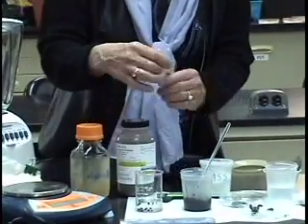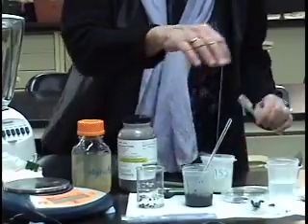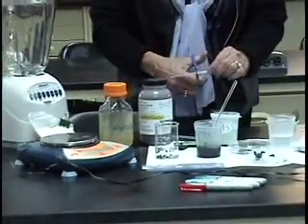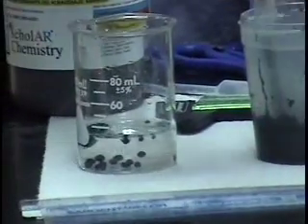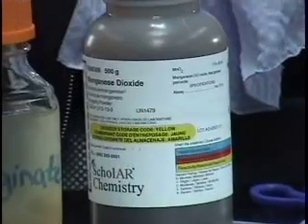And so they would use droppers to simply drop the mixture into the solution, and they can experiment with droppers that they would make of different size.